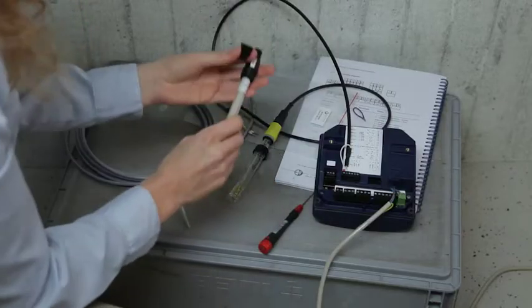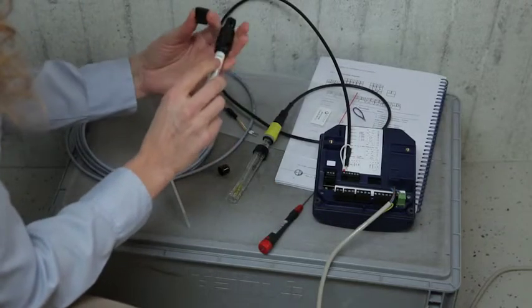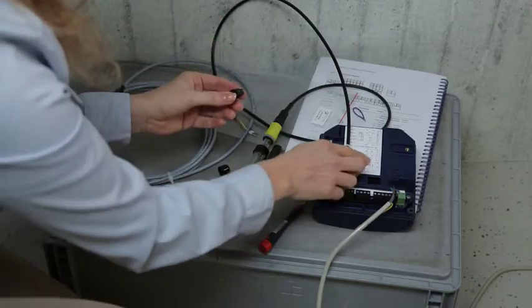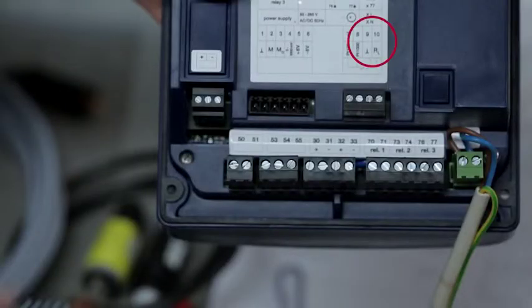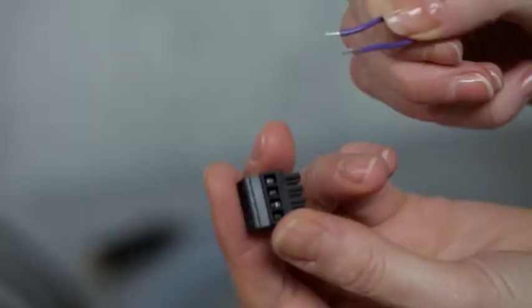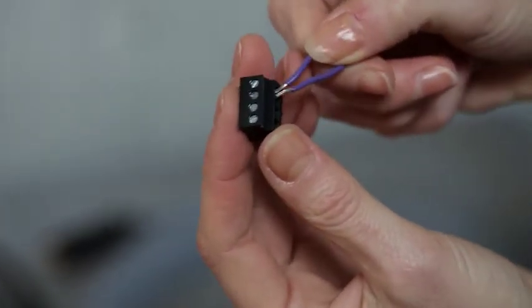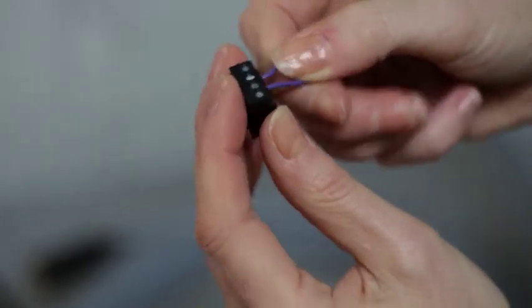Temperature is measured through a PT1000. Terminals 9 and 10 are bridged as the sensor is connected by way of a 2-wire system.